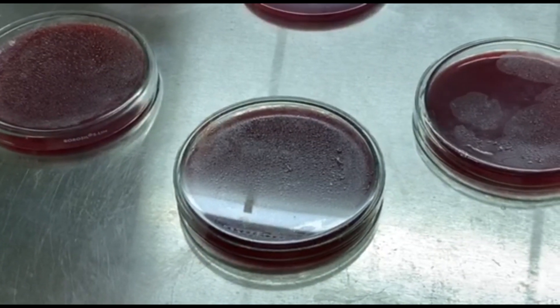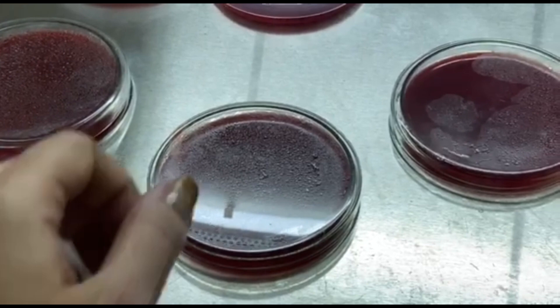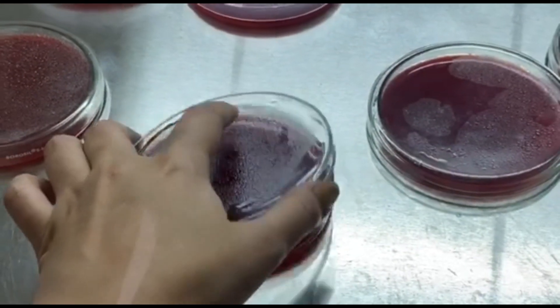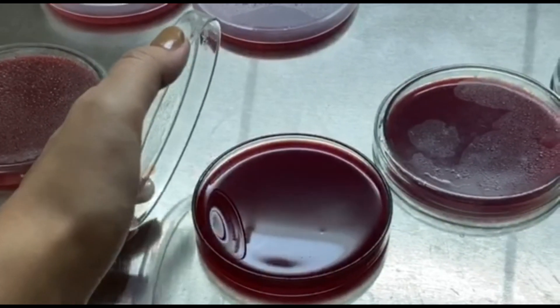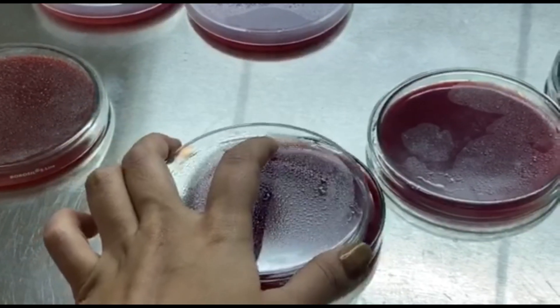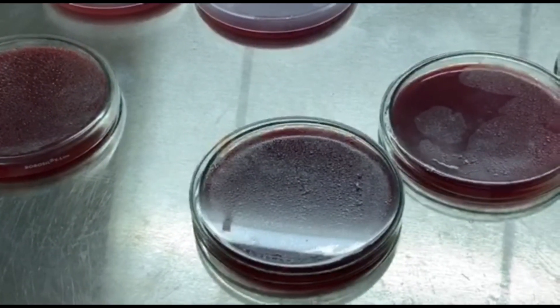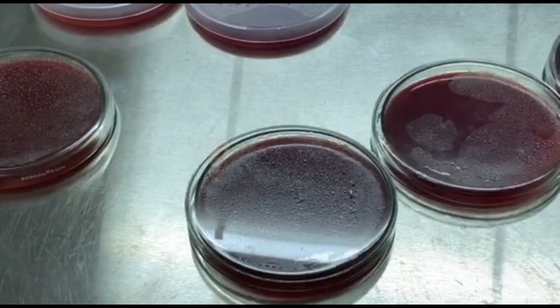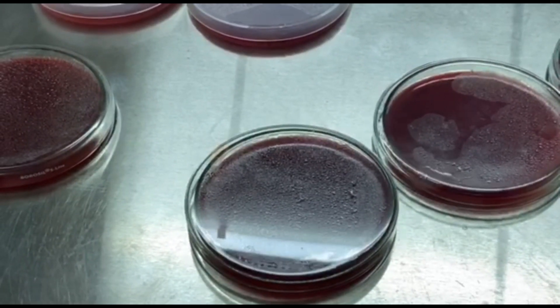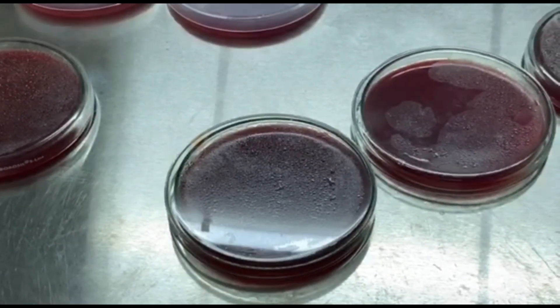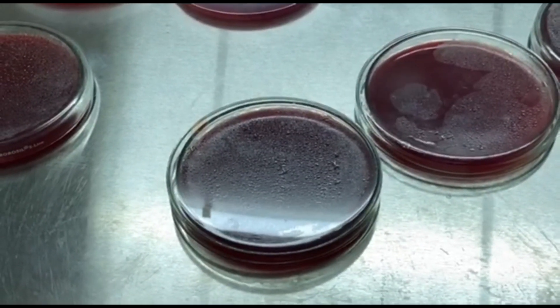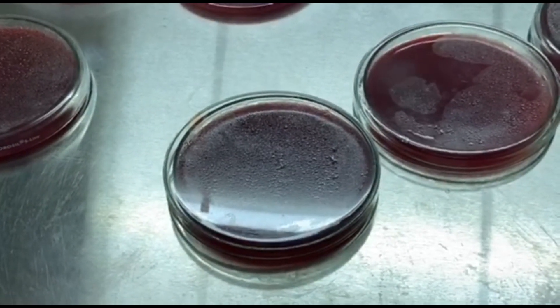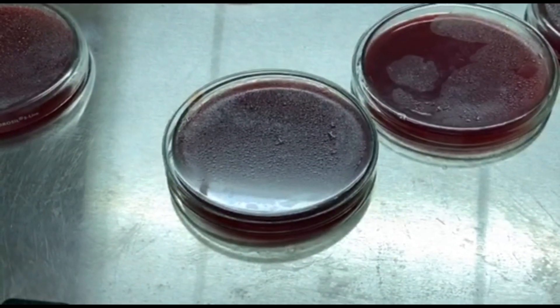After about one hour, the plates have dried and you can check. That's complete solidification of agar. You can open the plates - you can open the sterile plates outside - you can open the plates if the laminar hood is on. Do not open the plates outside in normal temperature because it might have a chance of getting contaminated. So that is how we prepare a blood agar media.